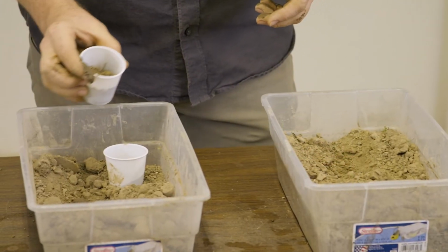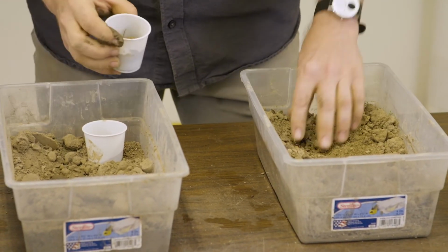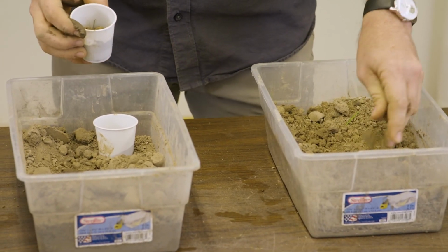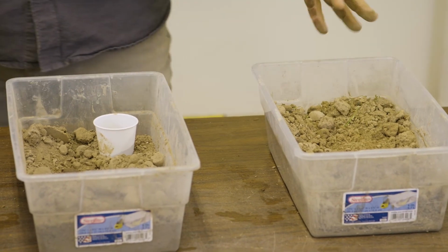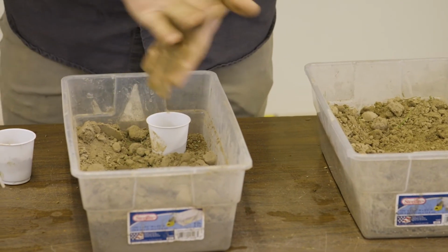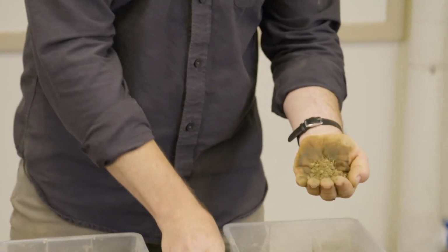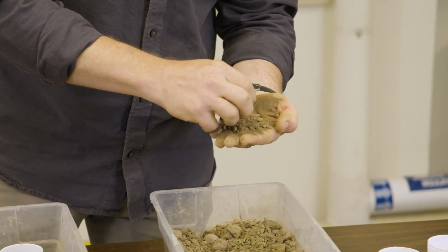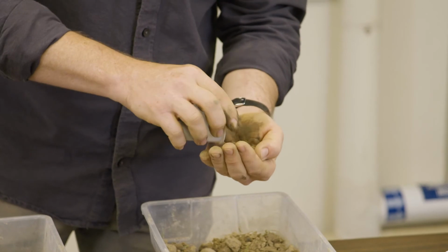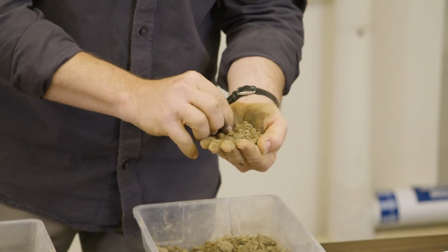By appearance alone, there's not really much we can tell. There's no way to visually distinguish these two soils in terms of their texture here. But by running through this soil texture by feel, we should be able to make some conclusions. Let's make sure we get all the last sample off. Okay, and again, we're going to sort the sample a little bit, removing some roots. Make sure we have a sufficient quantity there to get our ribbon.